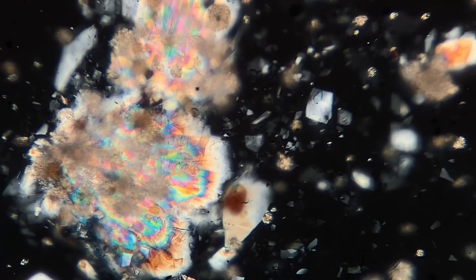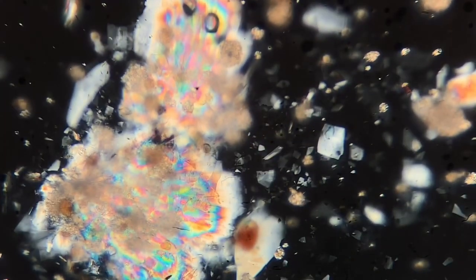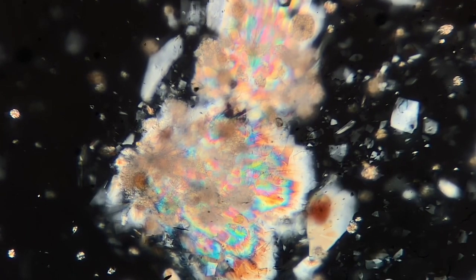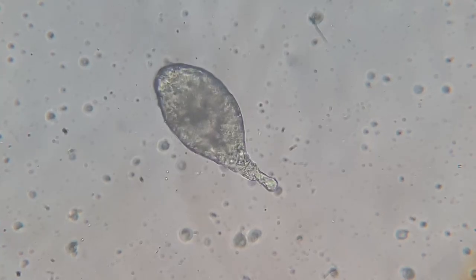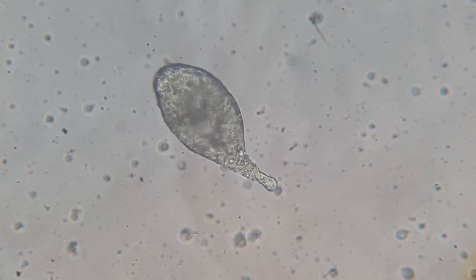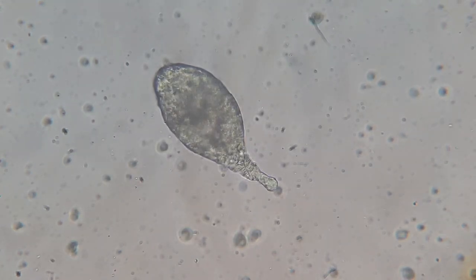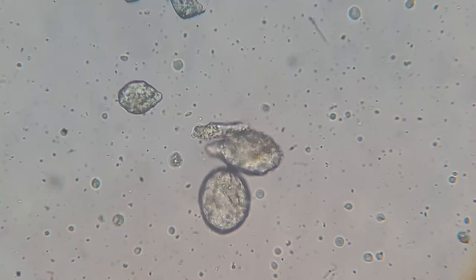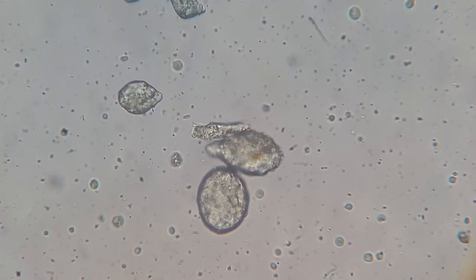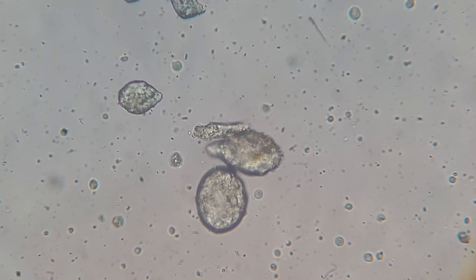Anyway, here are some crystals that I found in the unfiltered honey, and I put it underneath some polarized light. Here is a fungal spore — I believe it's called conidium. I'm not too familiar with fungi, but I believe here were some other fungal spores as well. I believe that's enough for the unfiltered honey.